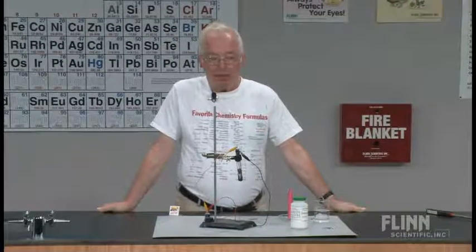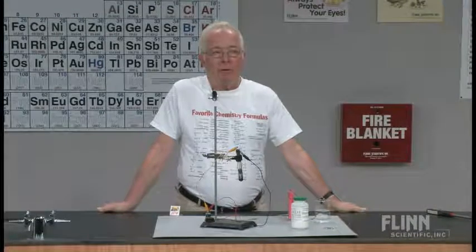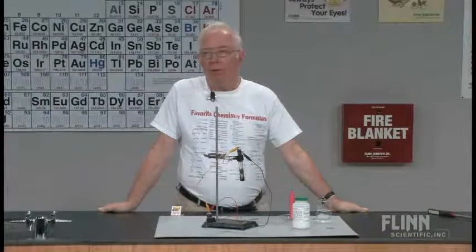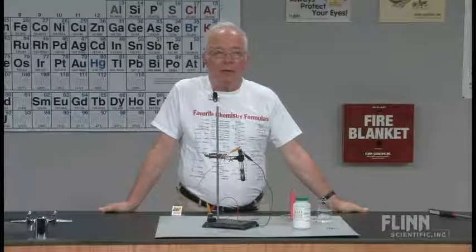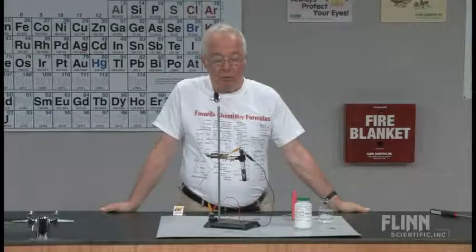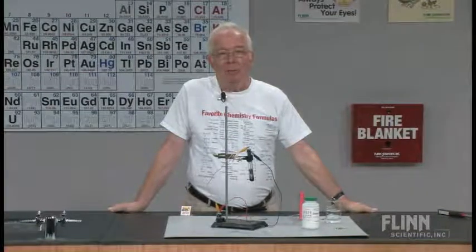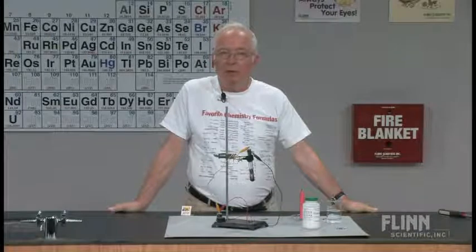When you heat potassium hydroxide, even with a candle flame, the melting point of potassium hydroxide is low enough that liquid potassium hydroxide forms. And since the buzzer went on, we know that the ions must have been present there before. Because in solid potassium hydroxide, the buzzer didn't work. In potassium hydroxide solution, the buzzer would. But we didn't put any water in here, so we didn't have any reaction occur except the moving apart of potassium ions and hydroxide ions from each other — free movement in the system.